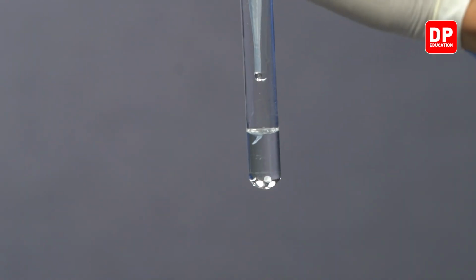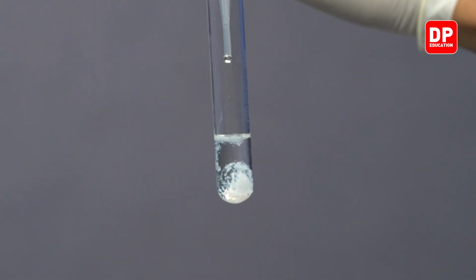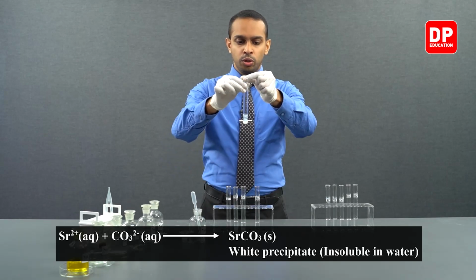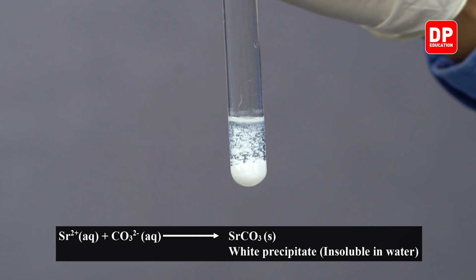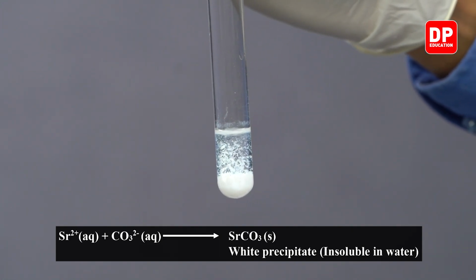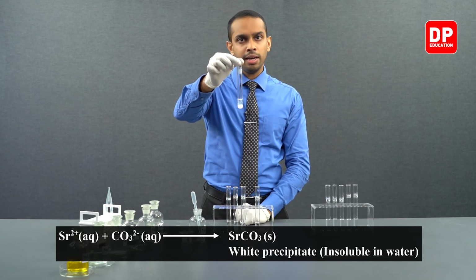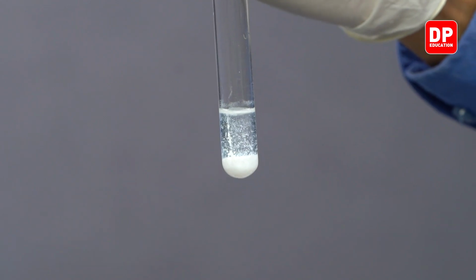Let's add a small amount of sodium carbonate. As you can see, when you're adding sodium carbonate drop by drop, a white color precipitate is formed. When strontium 2 plus ions come into contact with carbonate ions, they form strontium carbonate, which is a white color precipitate.